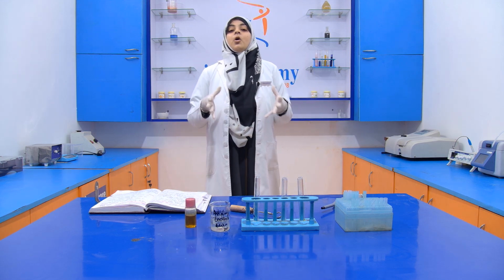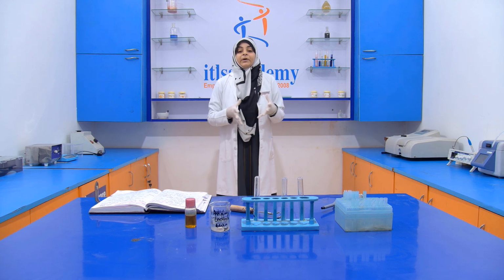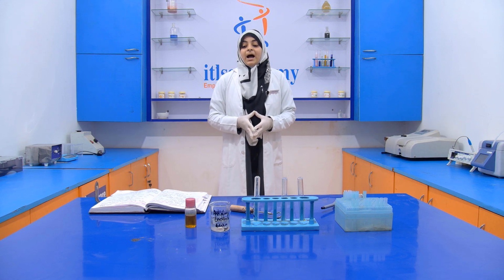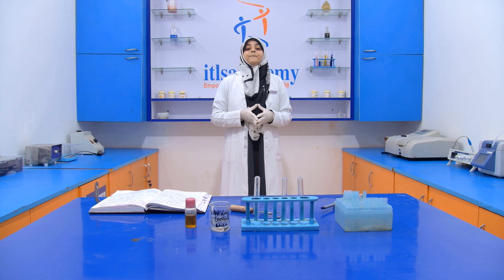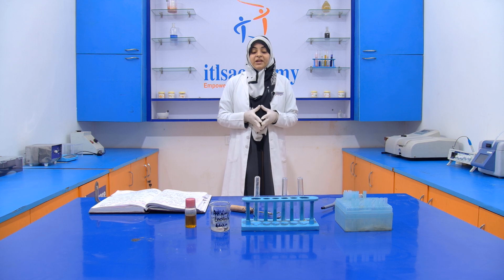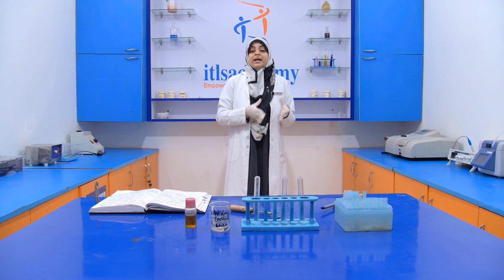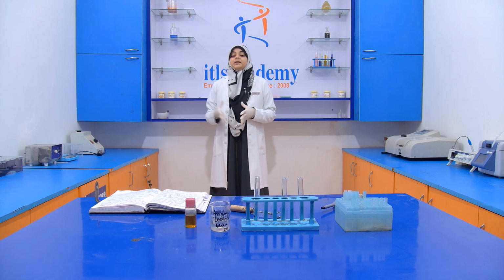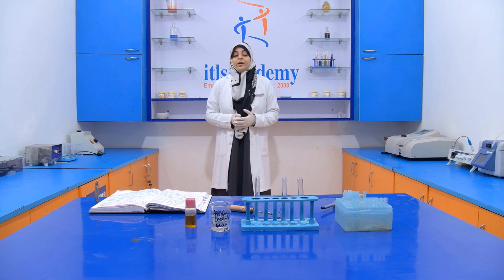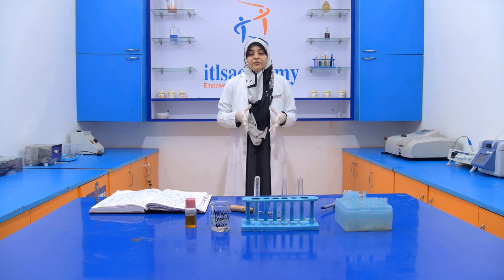is Karanjia oil. Now this Karanjia oil is used for medical purposes, like for healing, as a pain reliever, or you can say a painkiller, and also for stopping bleeding. But due to its bitter taste and sour flavor, it is not used for cooking purposes. And if it is adulterated with the edible oil, then it degrades the quality of the edible oil, or you can say it reduces the quality and the nutritional value of that oil.